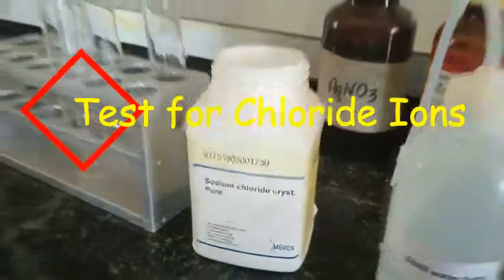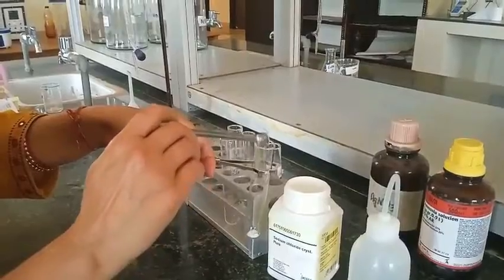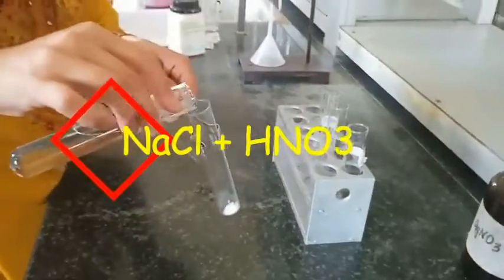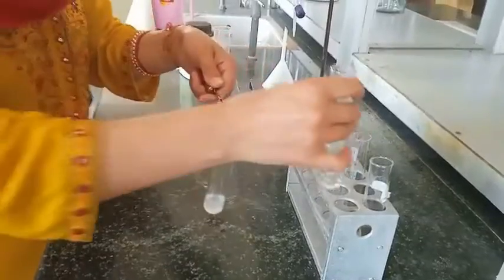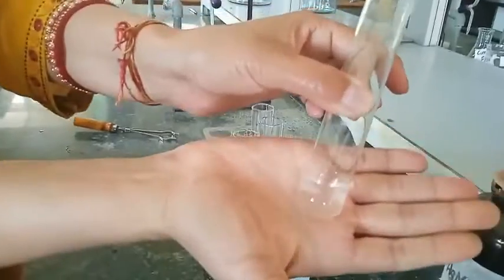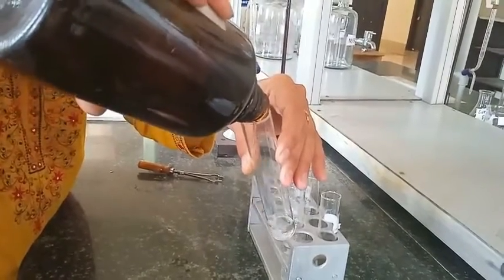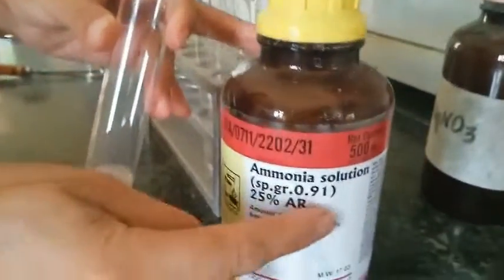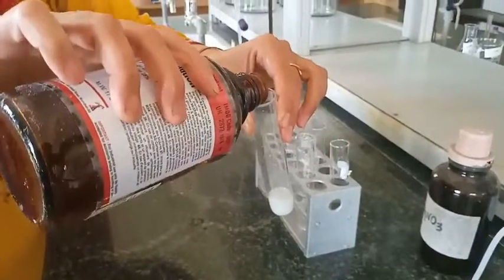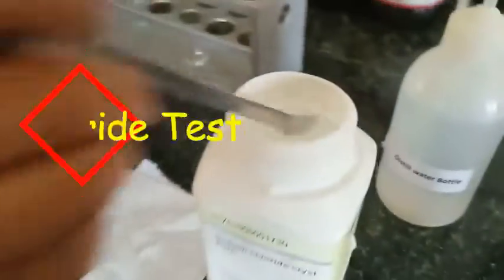Now test for chloride ions. I have taken sodium chloride salt in a test tube. To this salt I am adding HNO₃ acid to make a clear solution. Here you can see it is clear now. To this solution we are adding AgNO₃ solution. Here you can see the white precipitate of AgCl. These white precipitates of AgCl are soluble in ammonia solution, so I am adding ammonia solution — and here you can see these white precipitates are soluble. White precipitate, soluble in ammonia — chloride test confirmed.